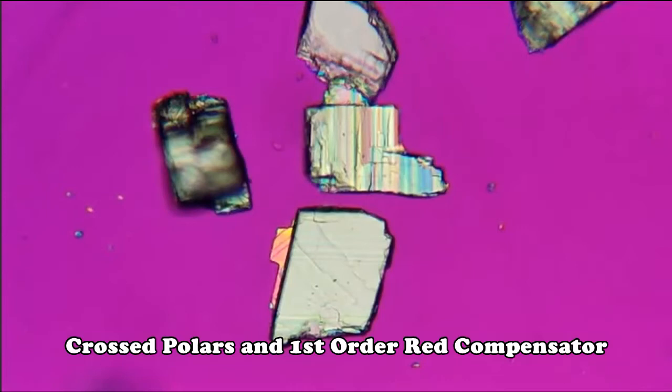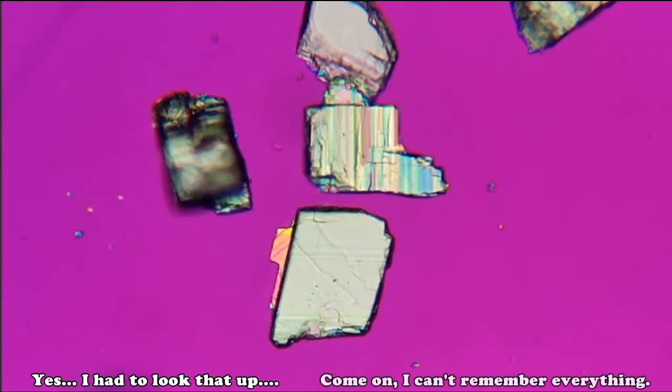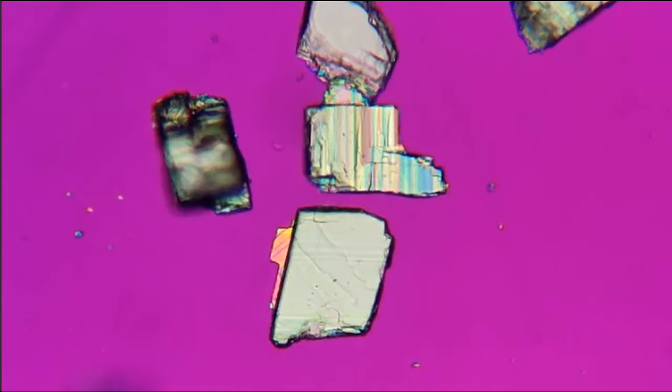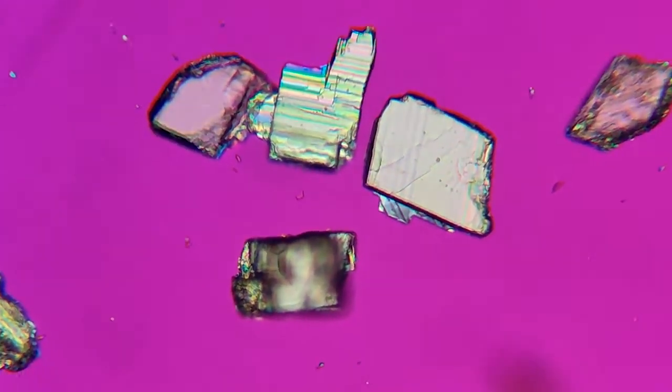Under this setup, a typical calcite crystal will yield a uniform yellow color because of its uniaxial crystal structure. Basically, that just means you have an anisotropic crystal with one unique crystallographic direction and either two tetragonal or three hexagonal directions which are alike and generally perpendicular to the unique direction of the crystal face. All that sounds impressive, but it basically means you have a yellow crystal no matter how you roll it around.